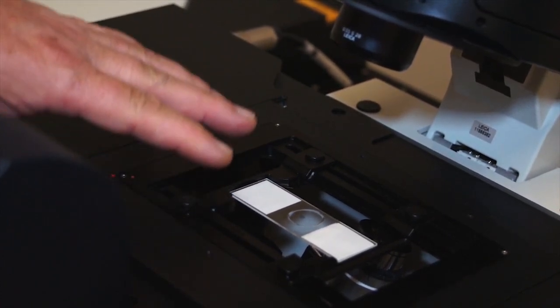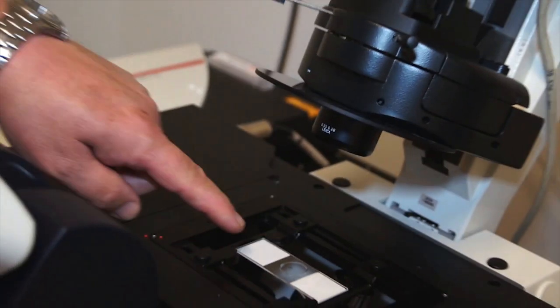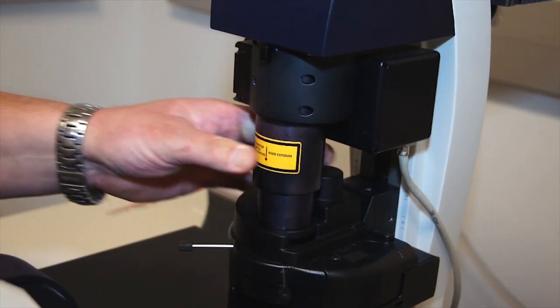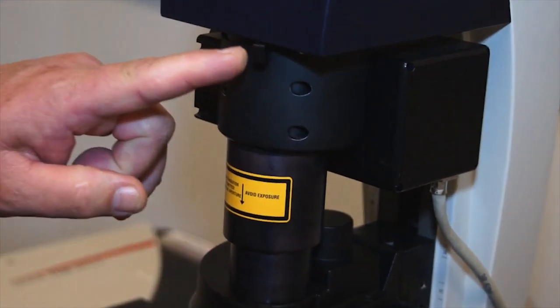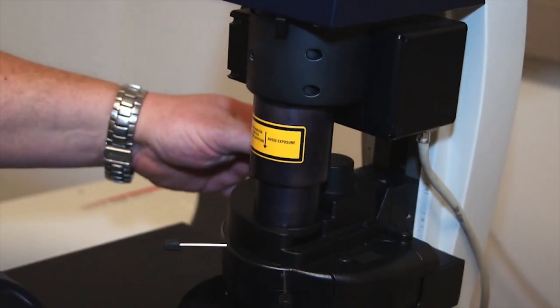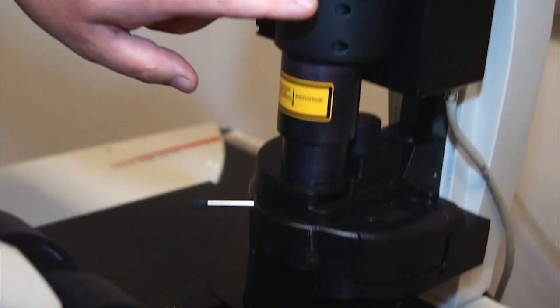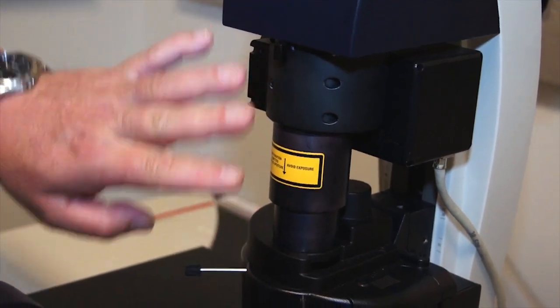To do Köhler illumination on the microscope: first put your slide on the stage, dial the 10x objective into the beam path, and lower the condenser into place. Focus your specimen at 10x, close the field diaphragm until you can see it in the field of view, then raise and lower the condenser until the leaves are nice and sharp. Align the field diaphragm to the field of view using the two alignment knobs, then open the field diaphragm just outside the field of view. Your microscope is now aligned at that objective.